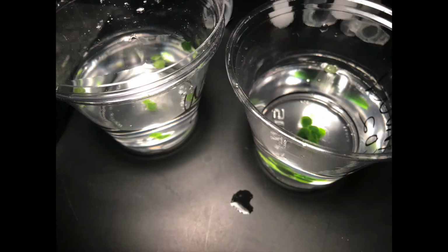All in all, by completing this lab, we learned the importance of having all reactants of photosynthesis. Since the distilled water lacked carbon dioxide, fewer leaf discs fully photosynthesized. We also learned that environmental variables like light intensity, color of the light, temperature, and pH all affect the rate at which photosynthesis occurs.